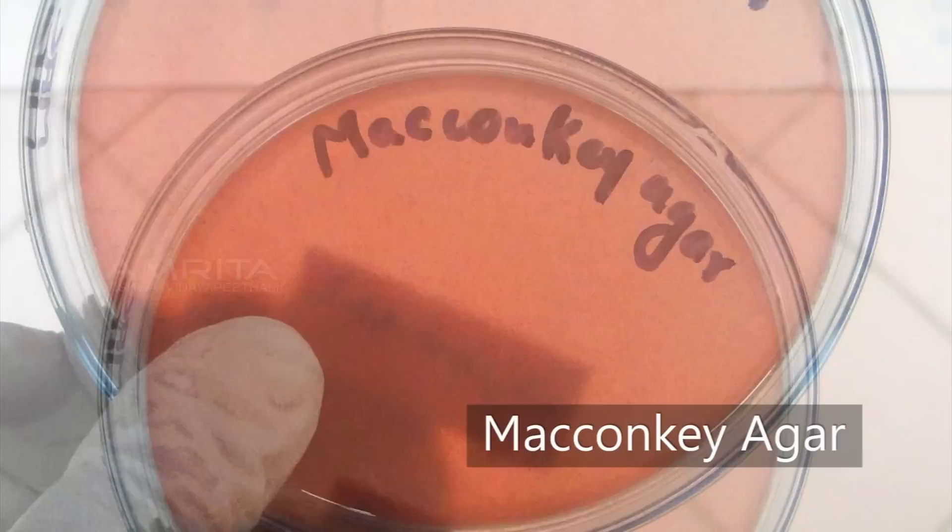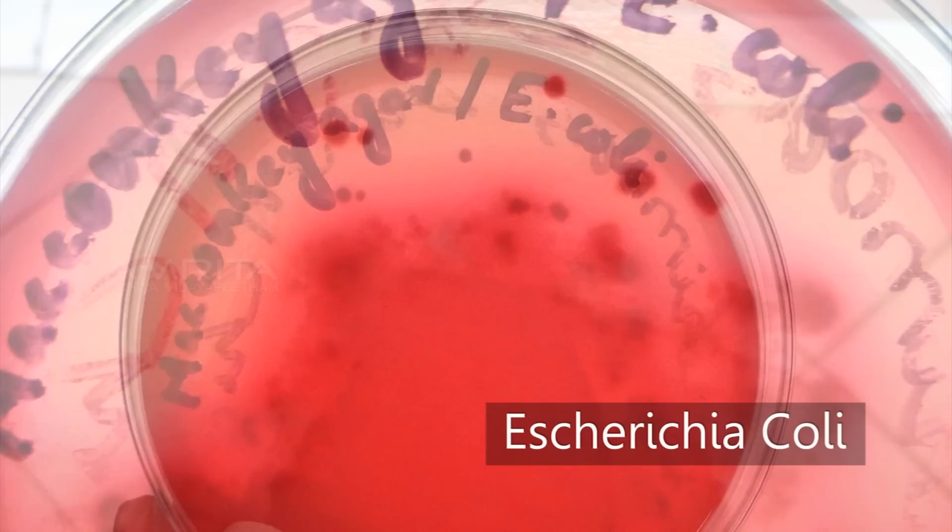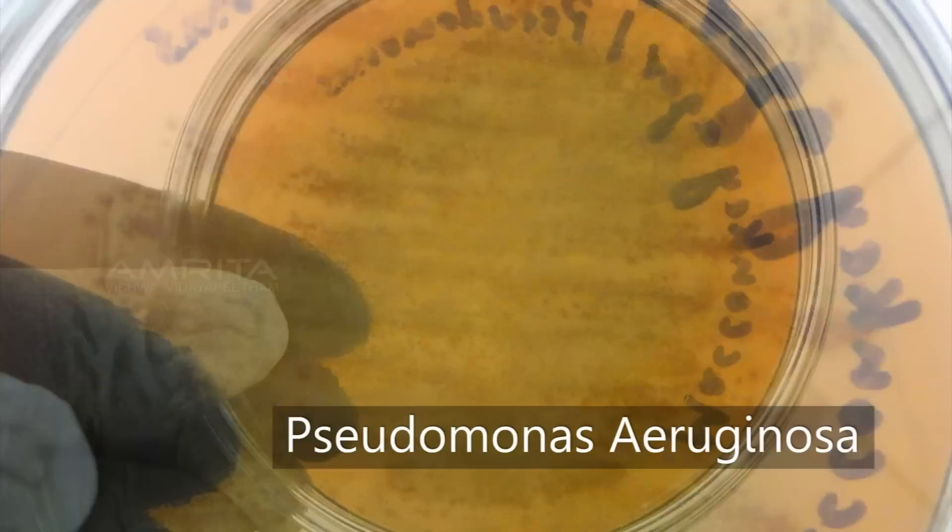MacConkey agar is selective for gram-negative bacteria and can differentiate those bacteria that are able to ferment lactose. Escherichia coli are lactose fermenters and thereby appear pink, while Pseudomonas aeruginosa are non-lactose fermenters and appear colourless or golden-coloured.